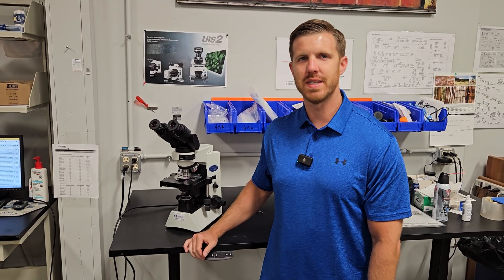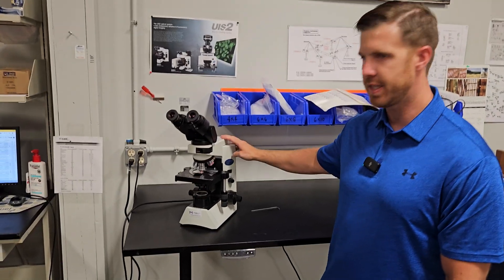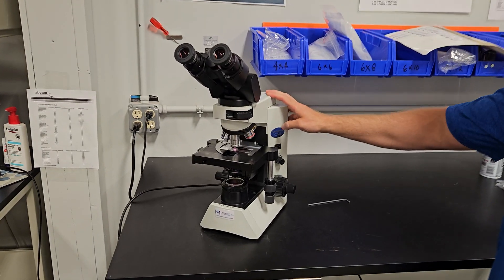Hey this is Chad with Monday Scientific. Today we're going to talk about the Olympus CX-41 microscope. This is an excellent microscope.